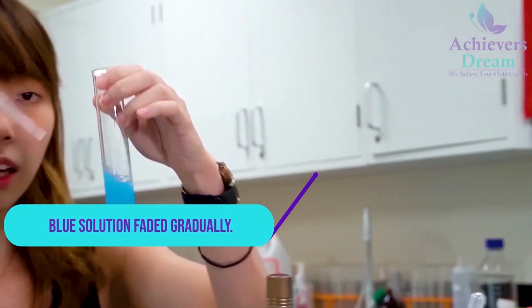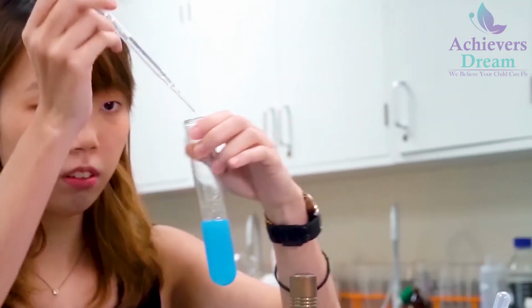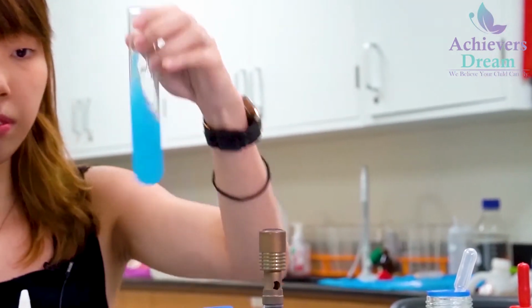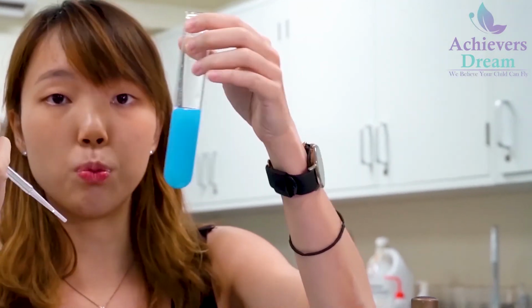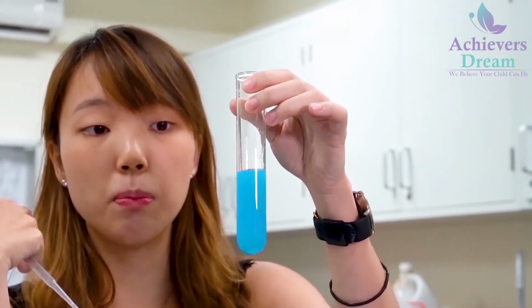Okay, it's slowly becoming lighter and lighter. Okay, so this is your final color. So your observation for this is that the blue solution would gradually fade upon addition of excess sodium carbonate.